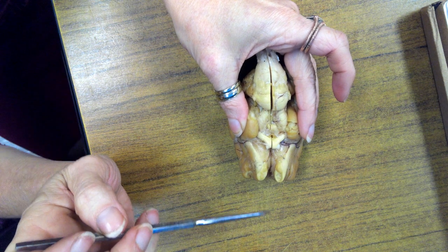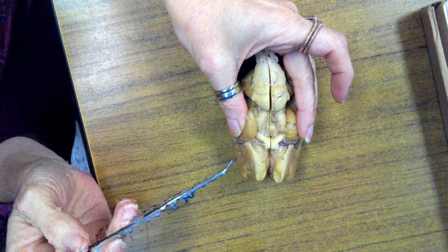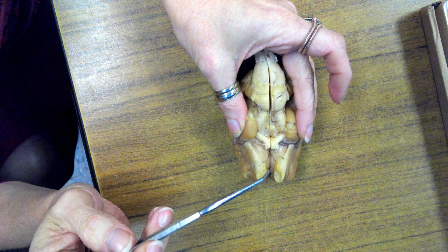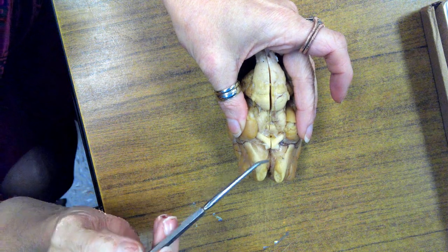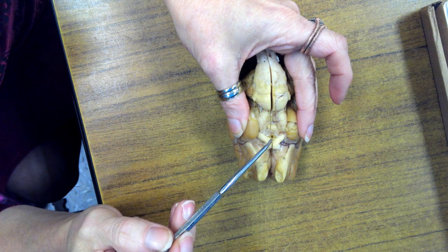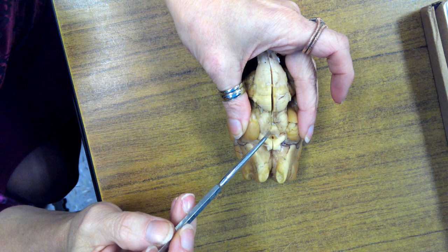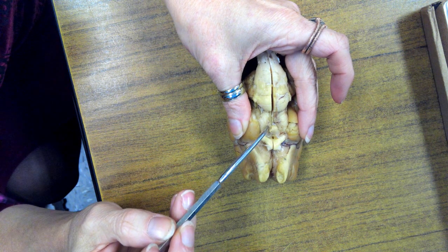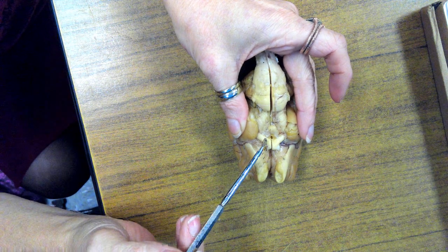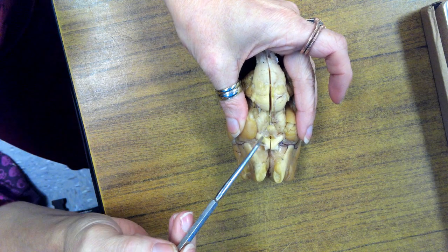If you were in fourth period, you might actually still have some of that stalk, and it won't just be the hole that it left behind. But that was special because y'all had the dura mater and got to remove it yourself. All right, so if you go just posterior to the infundibulum, then you've got a mammillary body right here. This one's kind of falling apart a little bit, and it's not perfectly cut in half here, as you can tell, but it's still very close.